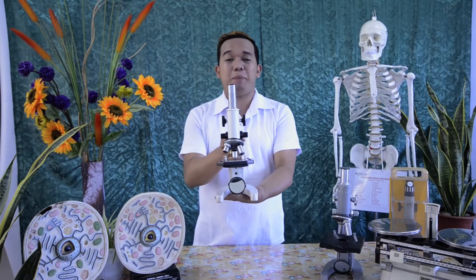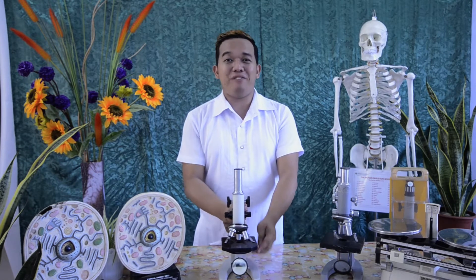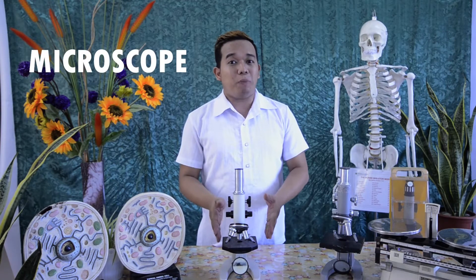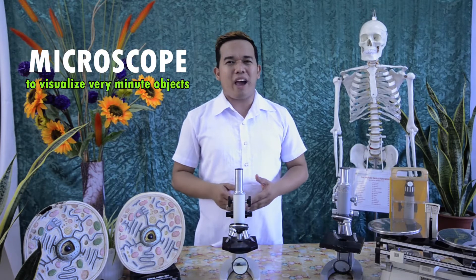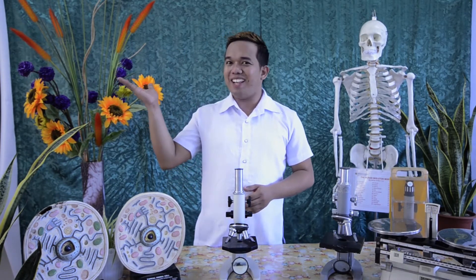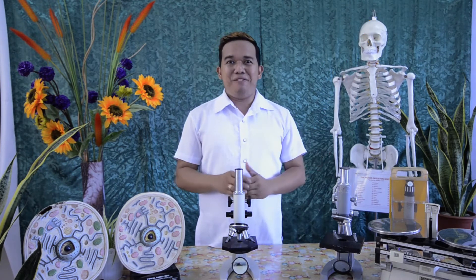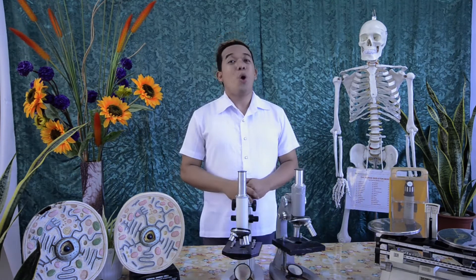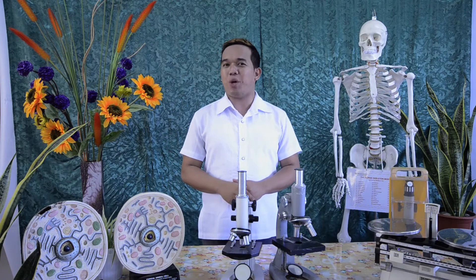Have you experienced manipulating a microscope? If not, I am sure you have an idea of what a microscope is. A microscope is an instrument used in science laboratories to visualize very minute objects such as cells and microorganisms, giving an inverted image that is magnified. We'll know more about a microscope and its parts with this video clip.